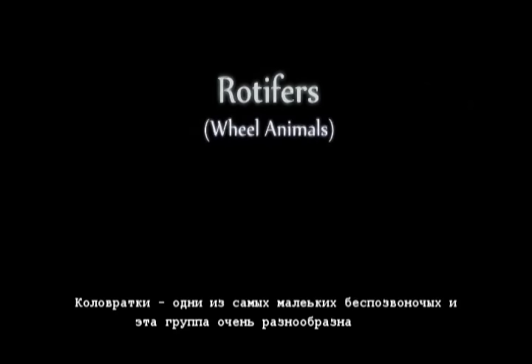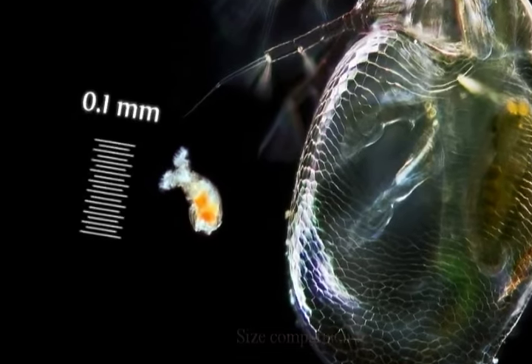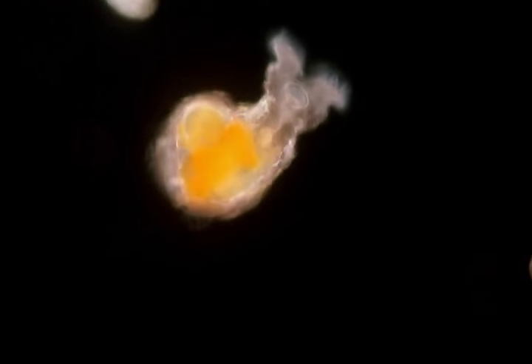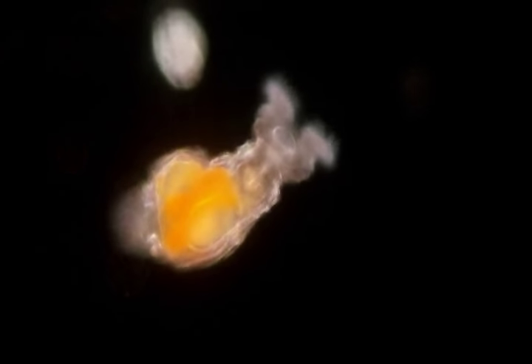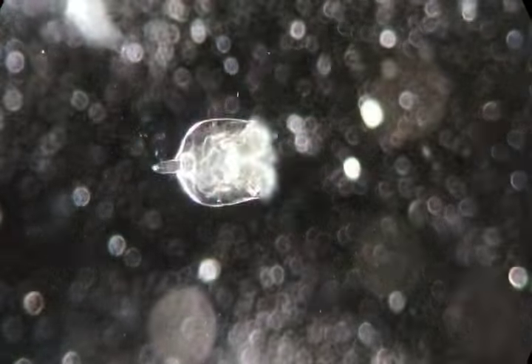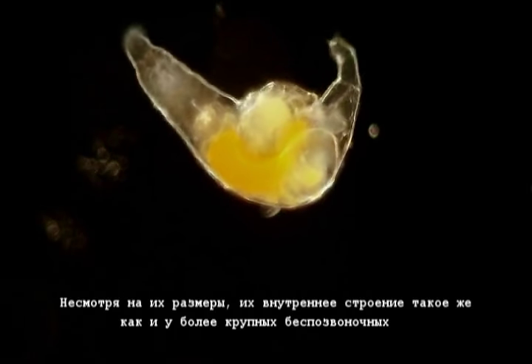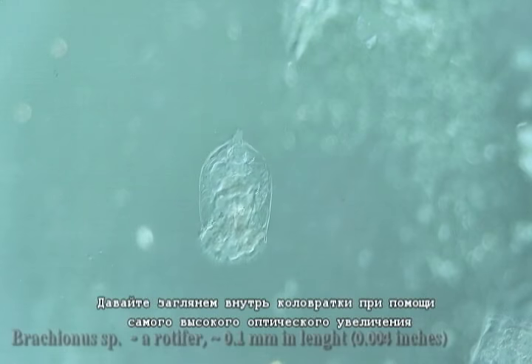Rotifers are among the smallest invertebrates, and the group is impressively diverse. Despite their size and unique morphology, they have all organs typical for larger invertebrates. Let's see the inner structure of a rotifer under the highest optical magnification.